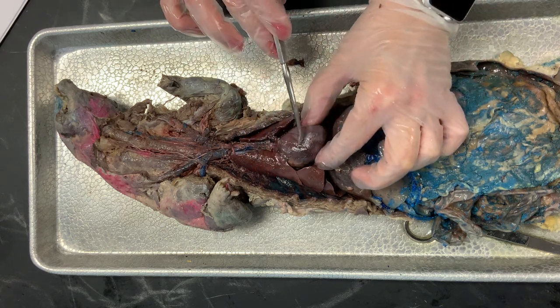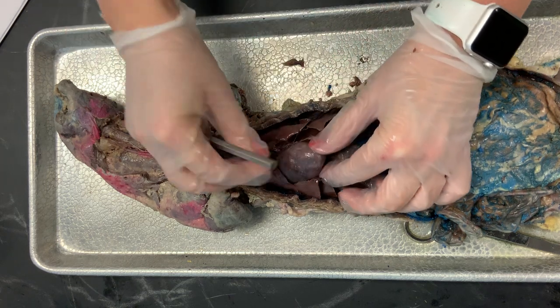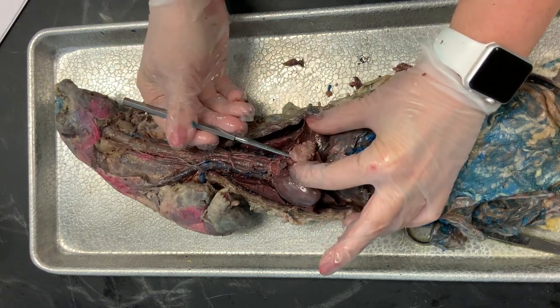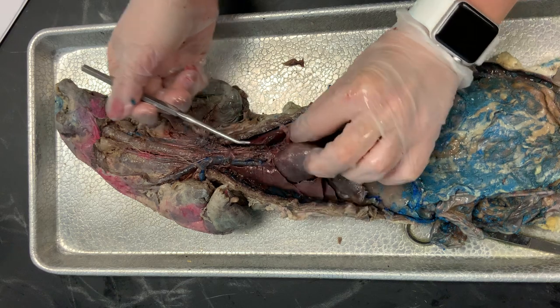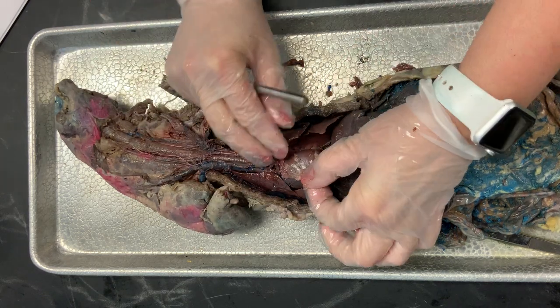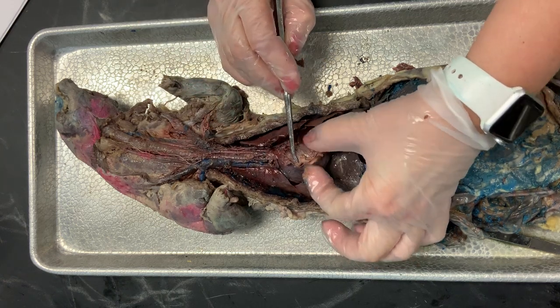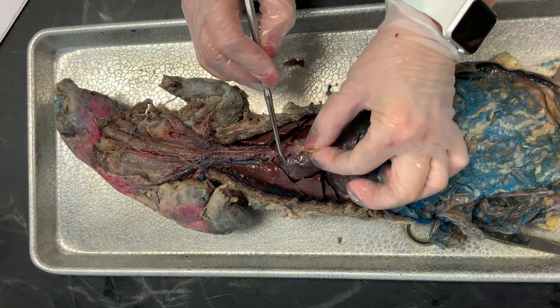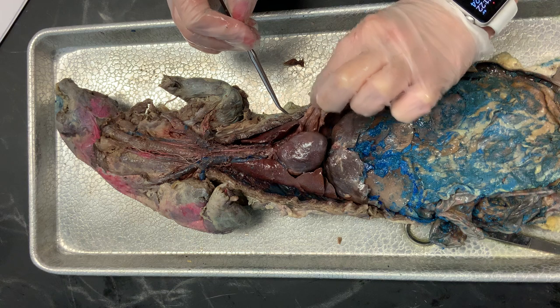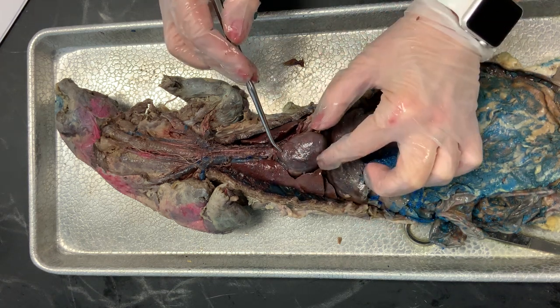Moving to the heart — the heart also has a membrane around it called the pericardium; I have cut it away. I left a little bit to the side. Getting the probe under it — see this part right here? That's actually part of the pericardium. I can stretch it back around the surface of the heart. That sac around the heart is the pericardium. I've cut it down the center and peeled it on the edges to expose the chambers of the heart.